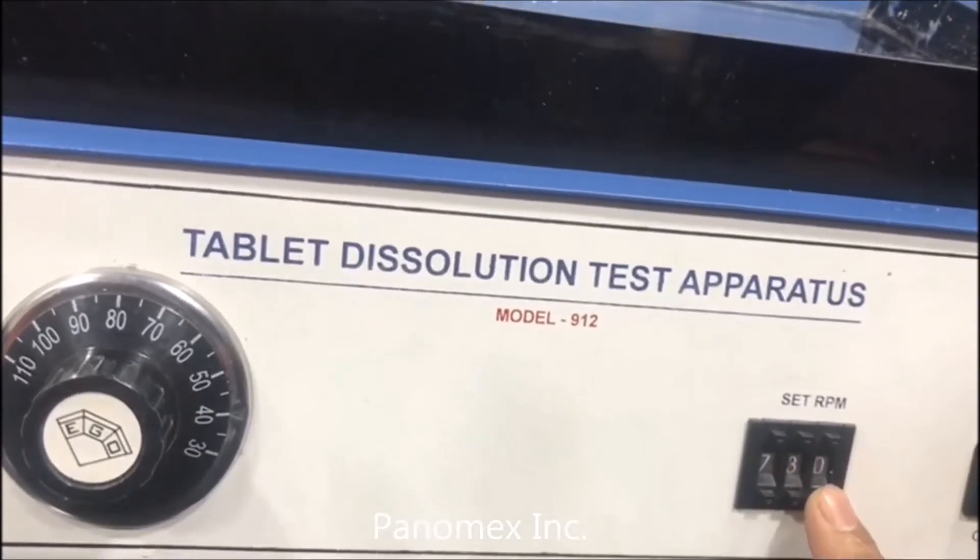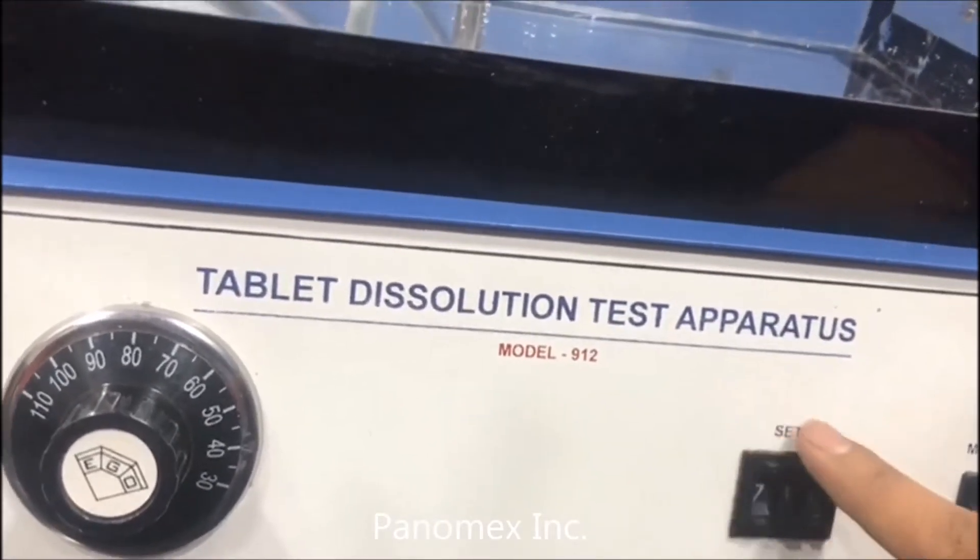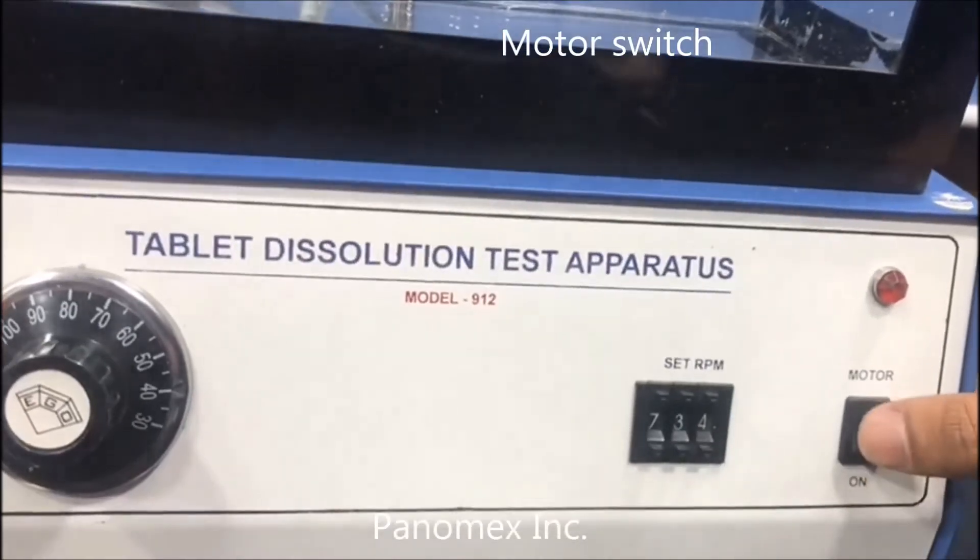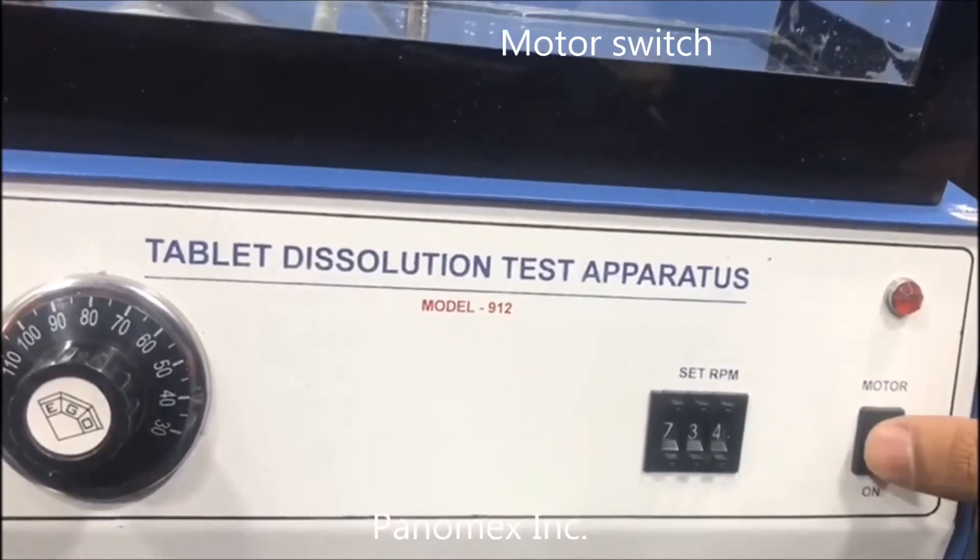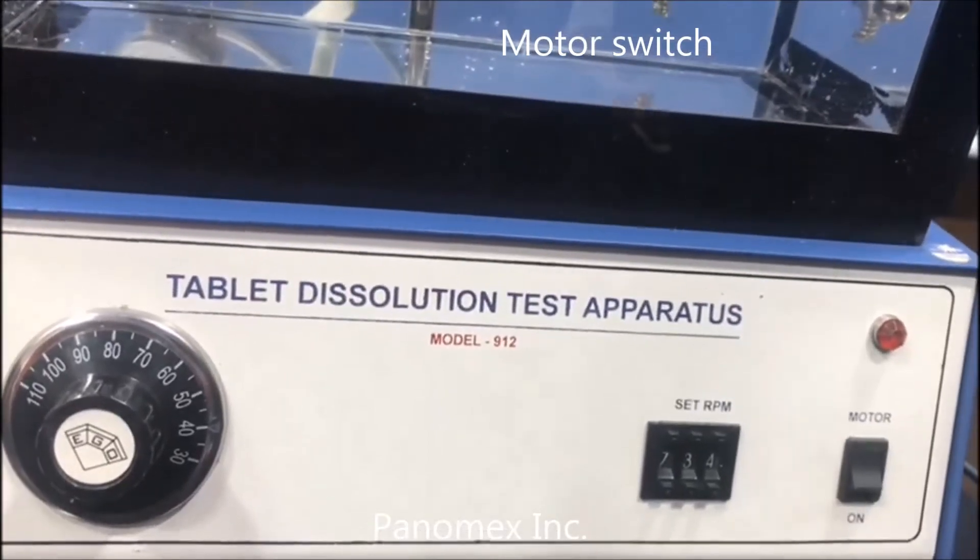This is the motor switch. You can turn it on and off like this while the stirring process is going on.